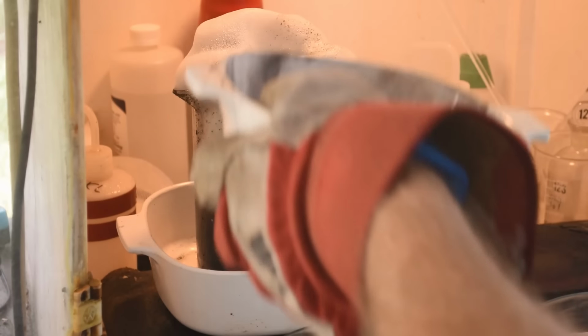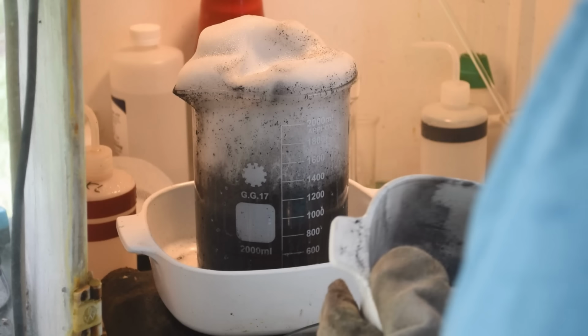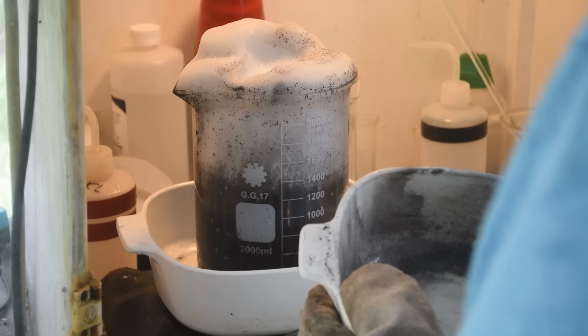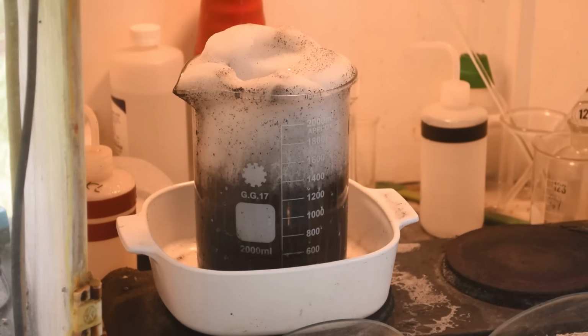Whoa. That's a lot of palladium in there. Chunky, too. Nice. Yeah, nice chunky palladium. Get that out of there. Oh, it's hot. Ugh. Right through the leather.